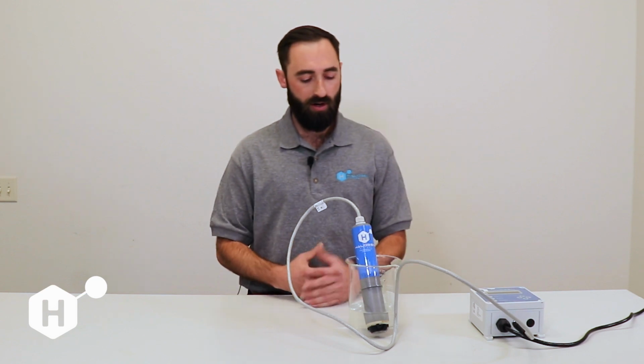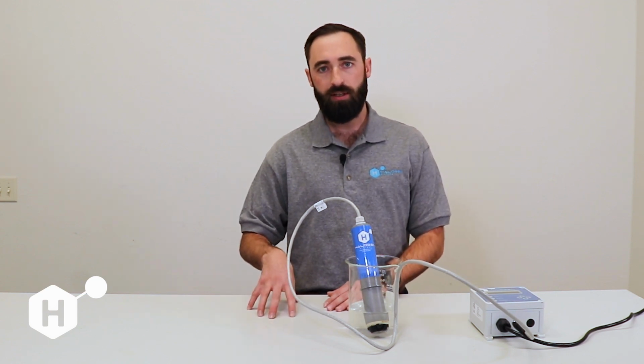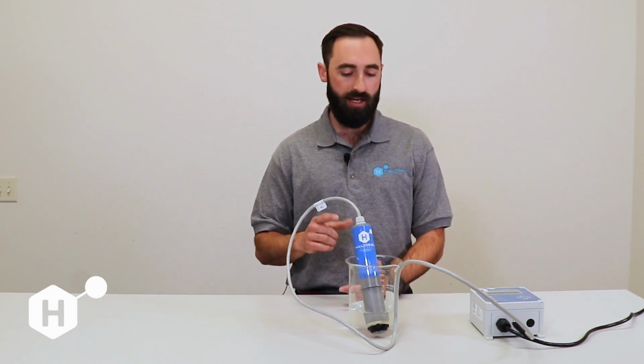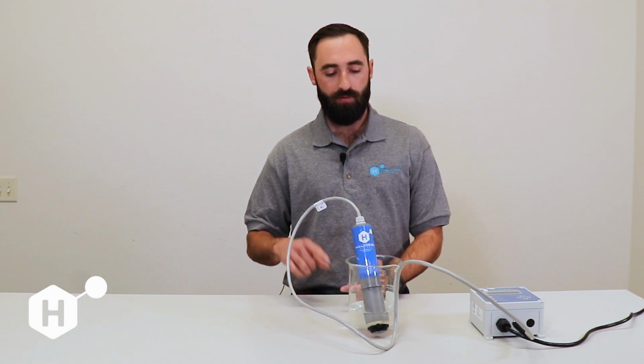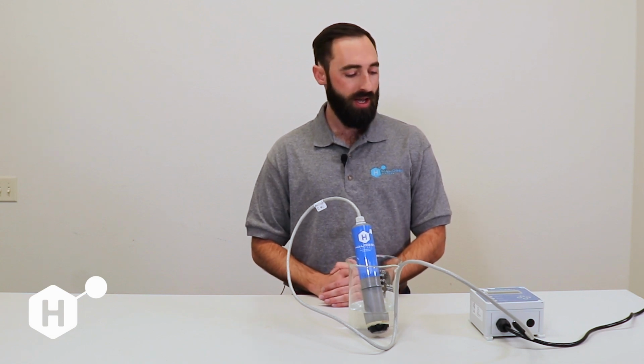Factory defaults are what we calibrated here in our Reno facility. We use an advanced flow-through system where we're able to change water conditions, and we do a multi-point calibration and quality check to calibrate each individual sensor for temperature, pH, conductivity, ORP, as well as chlorine, of course.